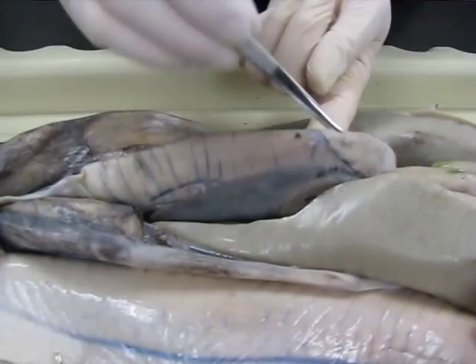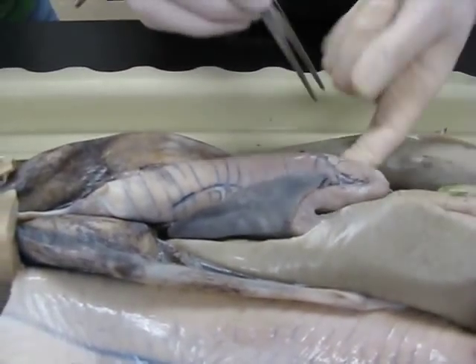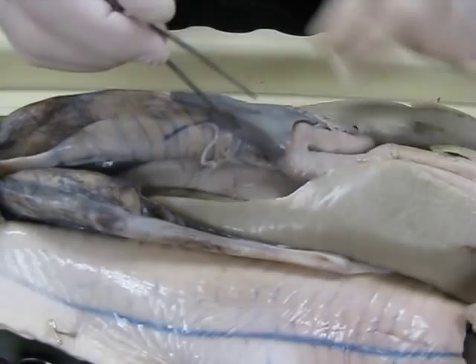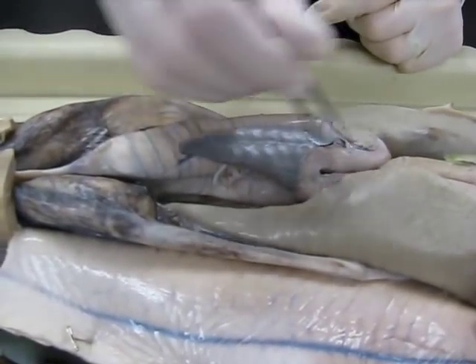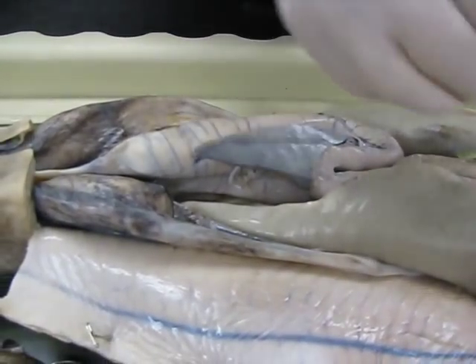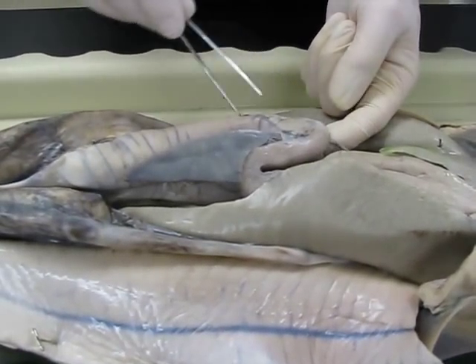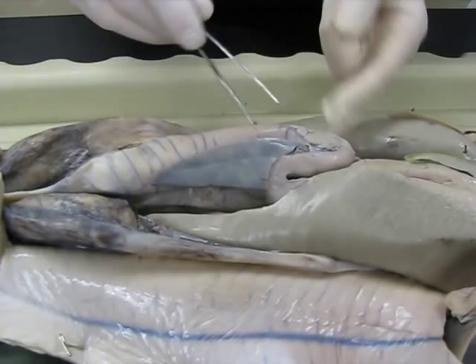Recognize that? It's in that part of the pancreas. That is pancreas, right? What about this? Spleen. That's spleen. What's this thing here? Stomach. It goes all the way from here down. And then from this point on, what's that? That's duodenum.